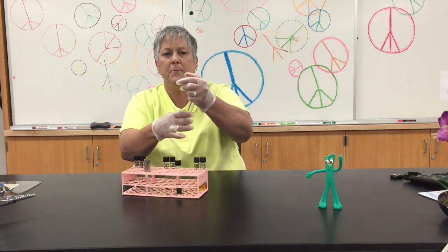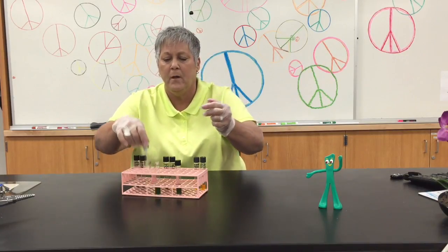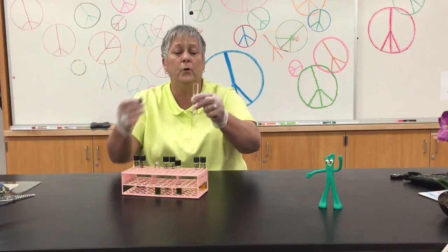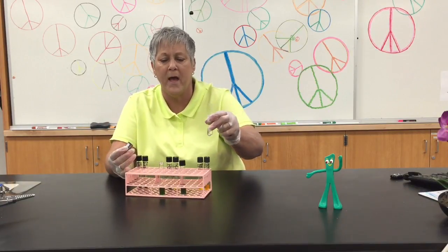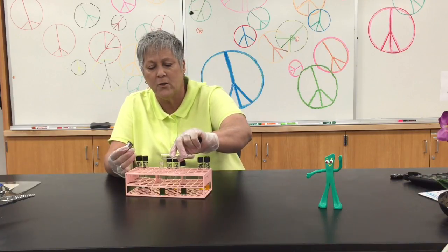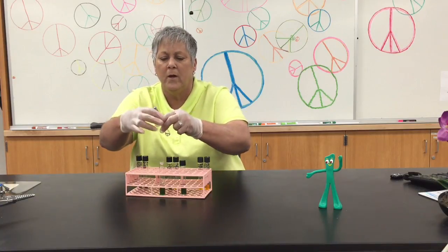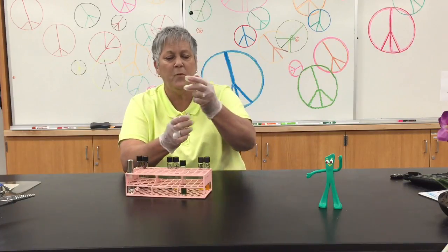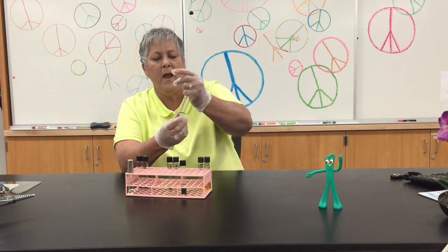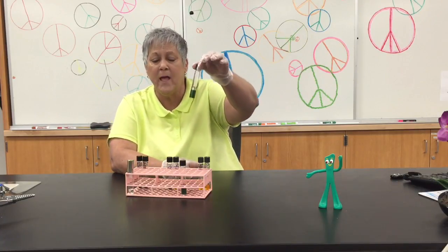Now we want to do this aseptically, and I'm not using any organism in this demonstration, but I would remove the cap, and here is my sterile mineral oil. You can either pour it by hand or you can use a pipette to add it. I usually am lazy and just do a pour. I don't want to touch the mineral oil tube to the tube that I just inoculated. And I'm going to pour maybe a 1/4 inch layer into that tube. Recap my mineral oil. I would have flamed my tube if there was organism in here, recapped it. And actually, I really have more oil in here than I need, but that's okay.